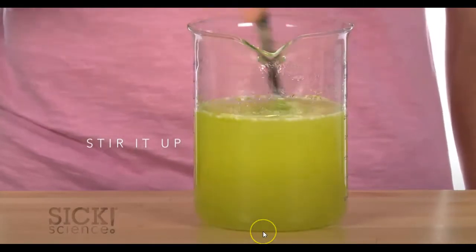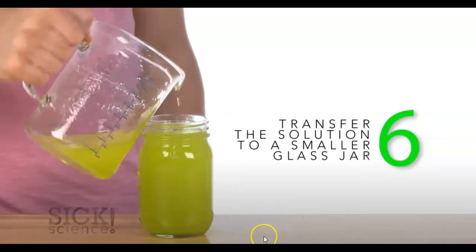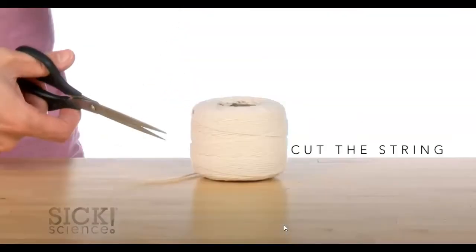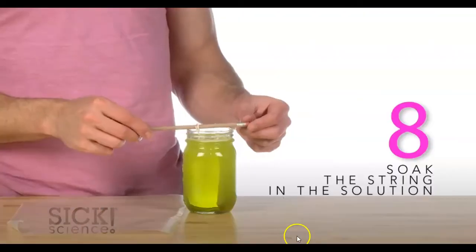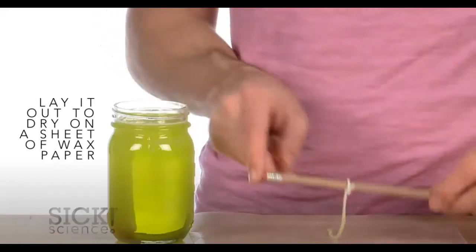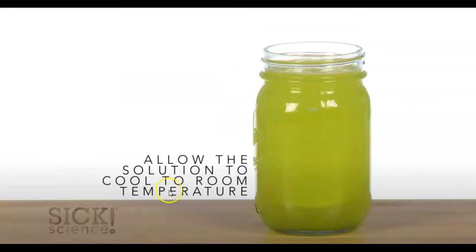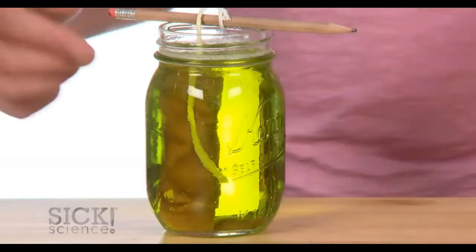Now, here's the really important part. They're going to move it to a jar, and they're going to take a string and dip it into the solution, and they're going to set that out to dry. And what that's going to do is allow some crystals to form on the string, so that after this solution in the beaker has cooled down, then they can insert the crystals and have somewhere for more crystals to grow.